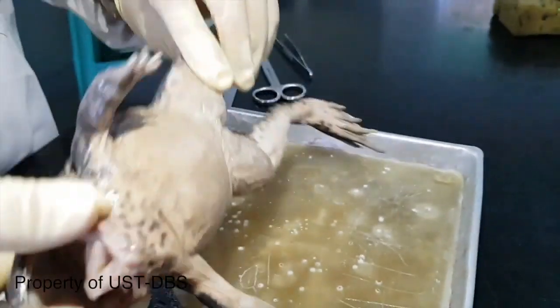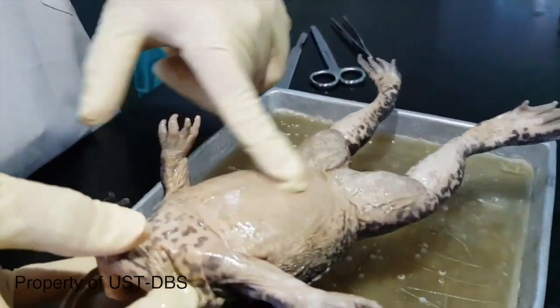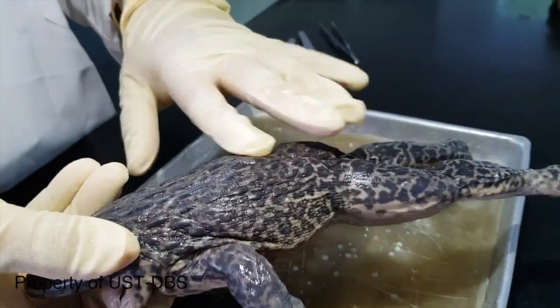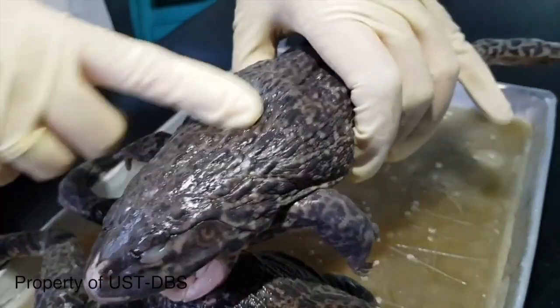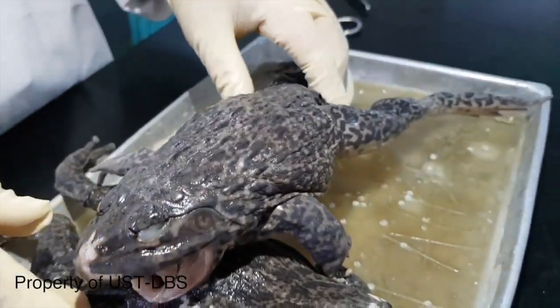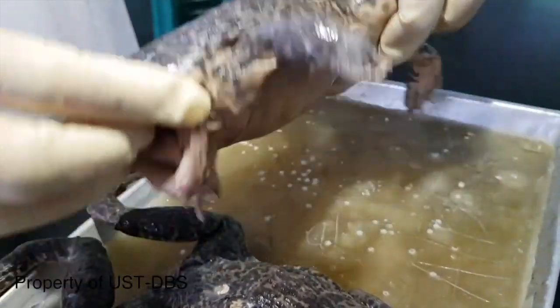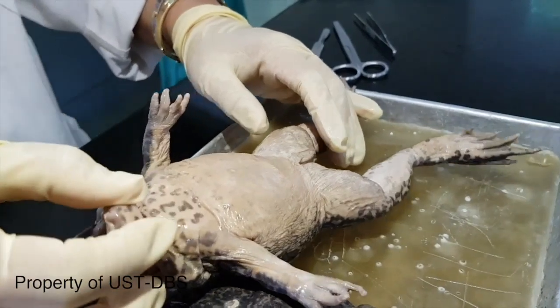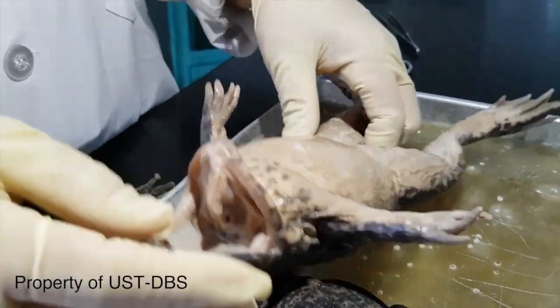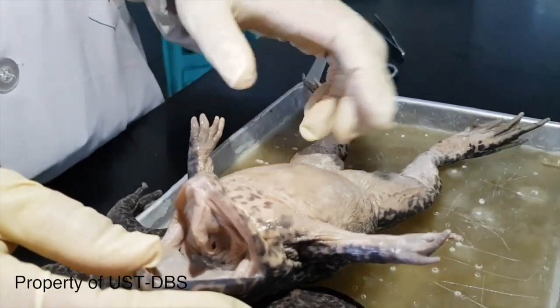On the ventral portion, you see that it's somewhat lightly colored as compared to the dorsal. And the warty skin for most of these frogs. Some frogs have smooth skin. And frogs have two types of respiration: buccopharyngeal respiration and cutaneous respiration. So they make use of their skin for respiration purposes.